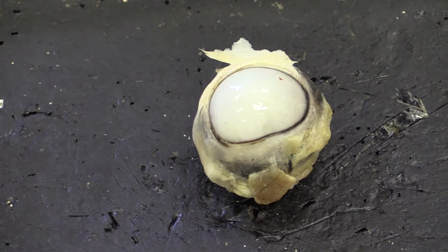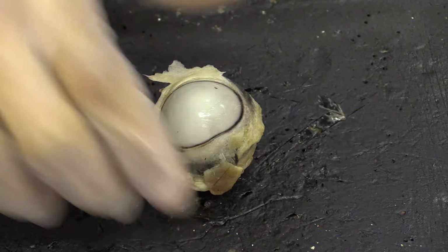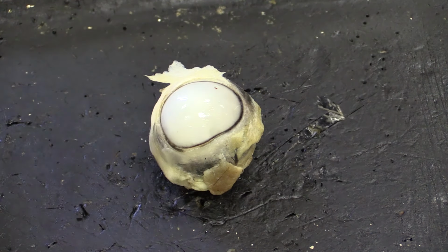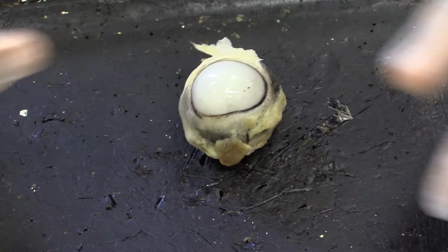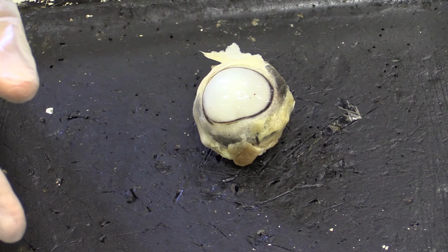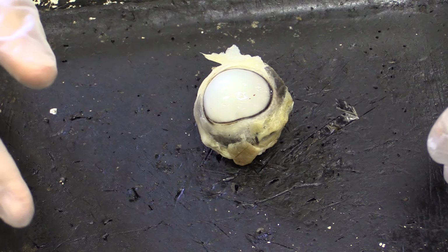To begin with, we have the sheep's eye here, and when it comes to the anatomy of the sheep's eye, we're going to actually look at a layer you can't even see with your eyes because it's 1 cell thick, and it's the conjunctiva just over the top of the cornea, which is a separate part which I'll go into in a minute. And the conjunctiva here is the bit that gets infected and inflamed when someone has conjunctivitis, or more commonly known as pink eye.